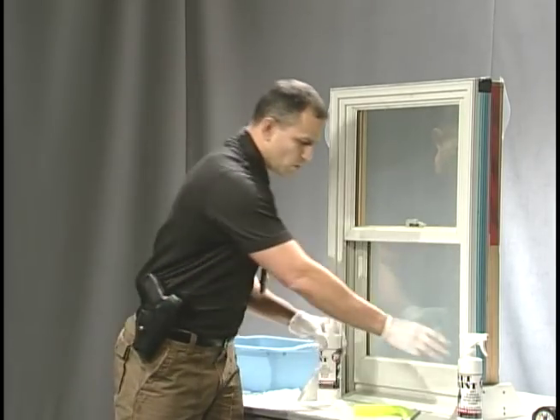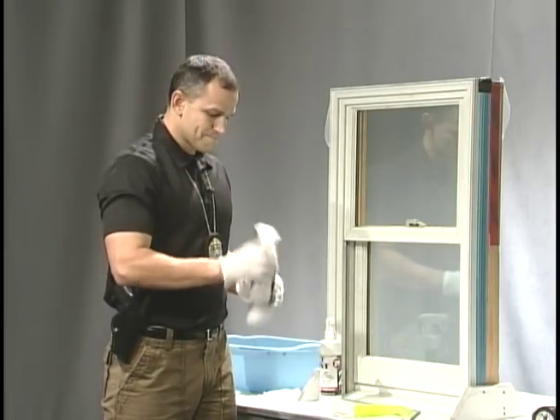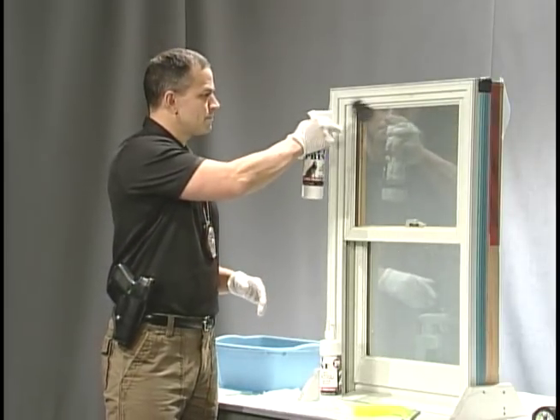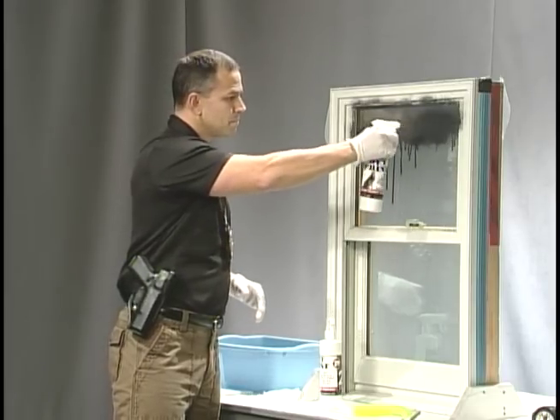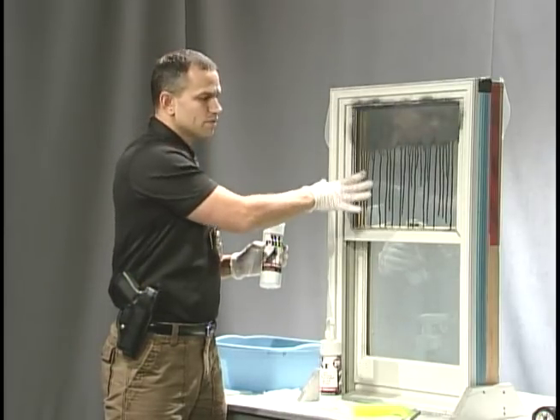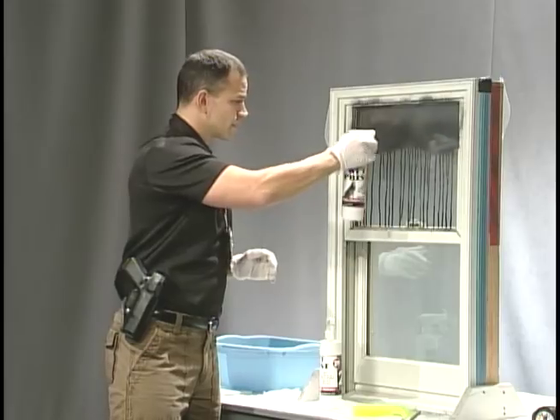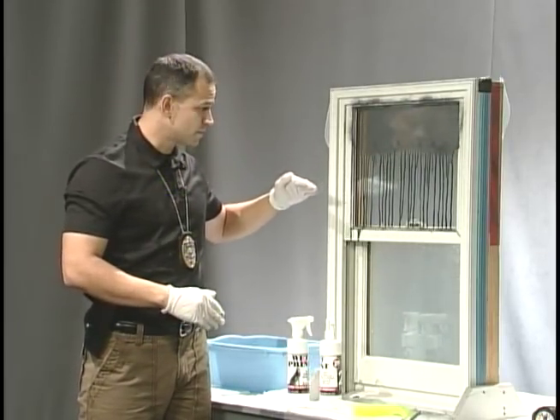You're going to find the bottle that has the number one on it. You need to make sure that you shake it, because the particles in the WetPrint are heavier than the liquid, so you have to keep shaking it throughout. We're going to start at the top — it's important that you start at the top and let it flow down into the fingerprint, because you don't want to spray directly into your fingerprints as it may disturb your prints. Look at those beauties — they're already coming up fantastic. I'm going to give that a few minutes to come down into our fingerprints as they develop.